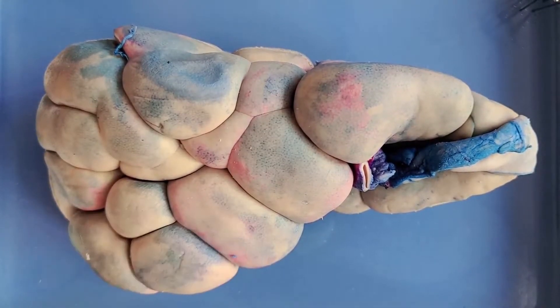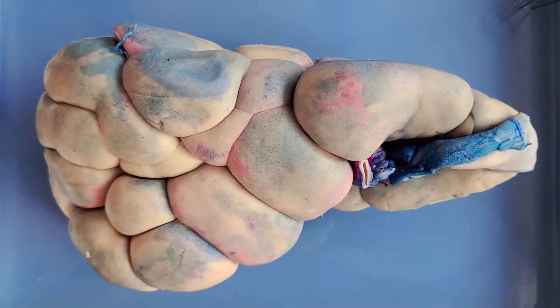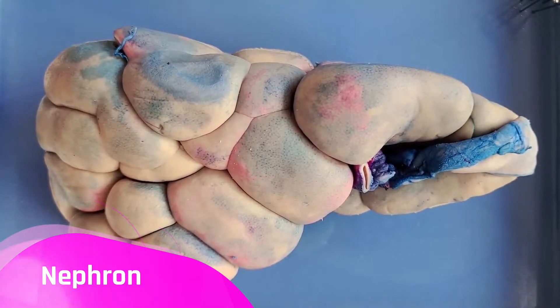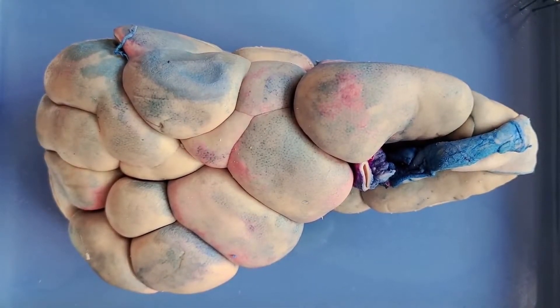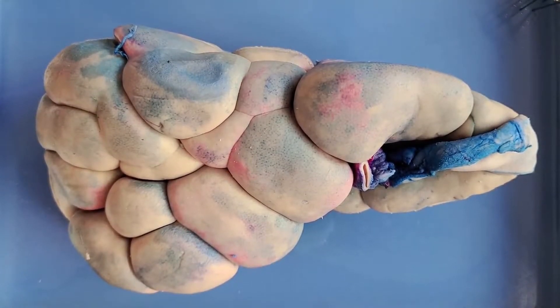You'll see this more when we cut open the kidney later in the video. Kidneys come in pairs, one on each side of your body. Each kidney has about 1.5 million blood-filtering units called nephrons, but people only need a minimum of 300,000 nephrons to filter blood properly. Because of this, you can get one kidney removed and function just fine. Interestingly, for children born with only one kidney, the lone kidney grows until it has the combined weight of two.